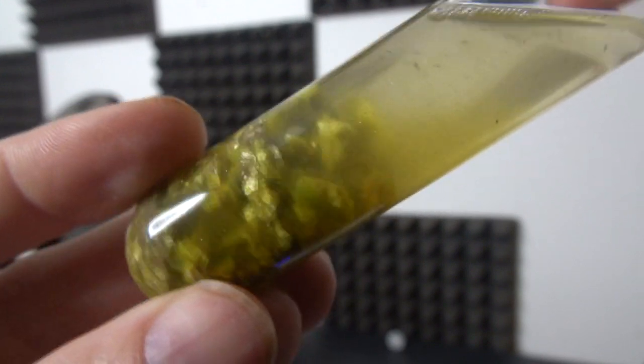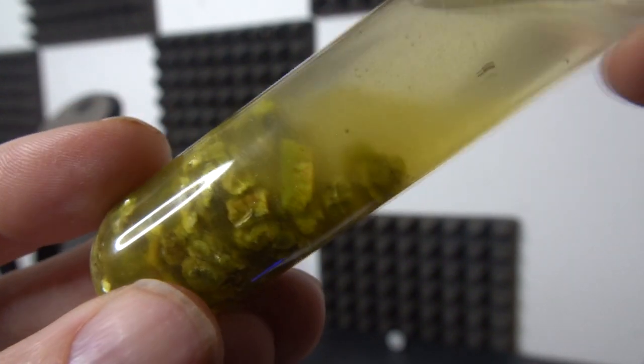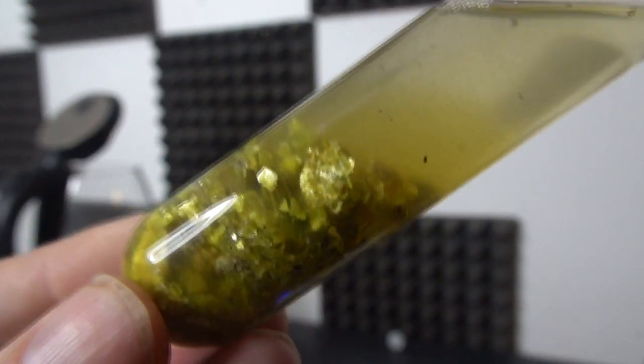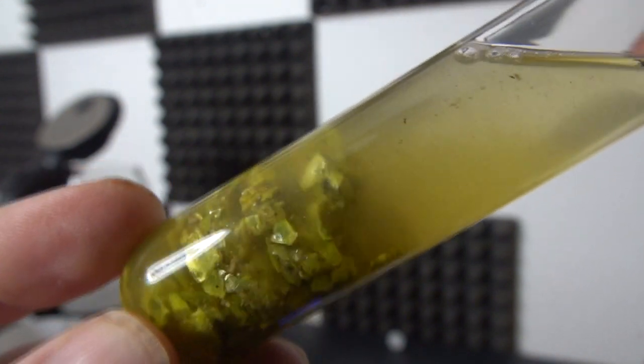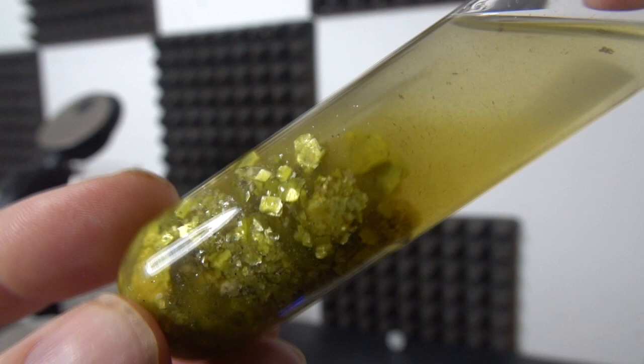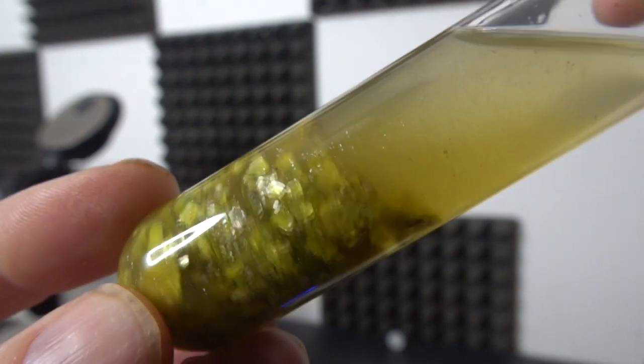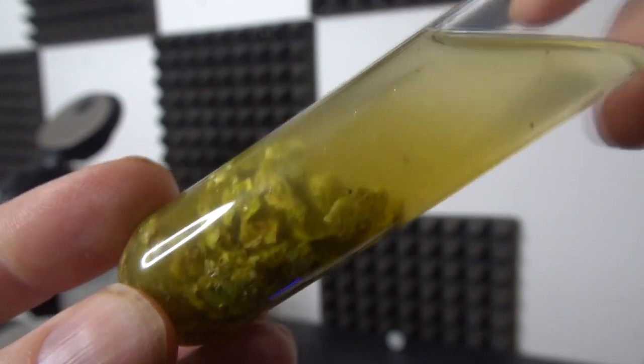I'm going to get most of this in solution. This is a purification step to begin with. And once I've done that I can precipitate it out as a peroxide and then I think probably what the game plan there is, there's so much that's tricky with uranium, I'll do a separate video with it.